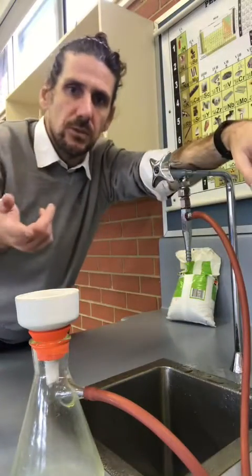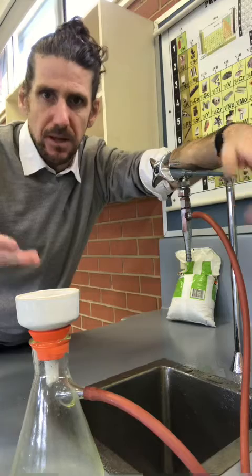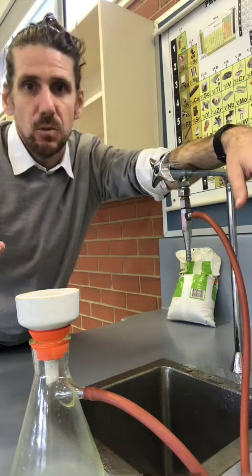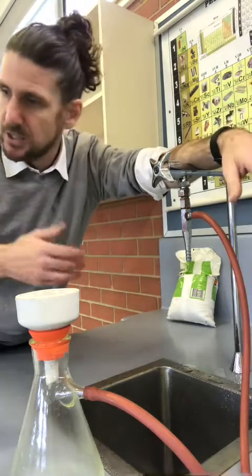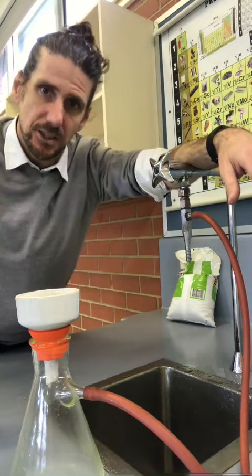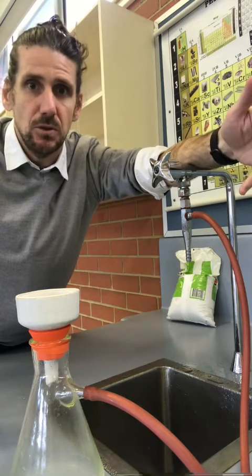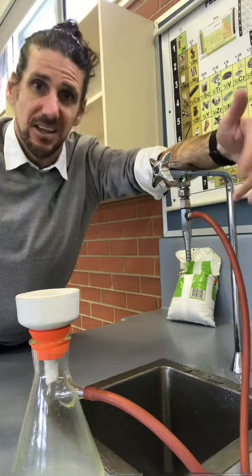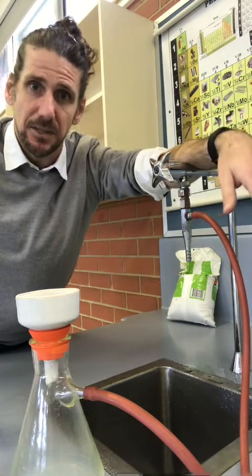Once everything is filtered, we then dry the filter paper and the precipitate and weigh it. Once I've got the weight of my barium sulfate, I can do some mole calculations and trace that sulfate back to what was in the fertilizer initially. Gravimetric analysis is a really simple tool — using precipitation reactions to find out the amount of something that will form a precipitate in a sample.